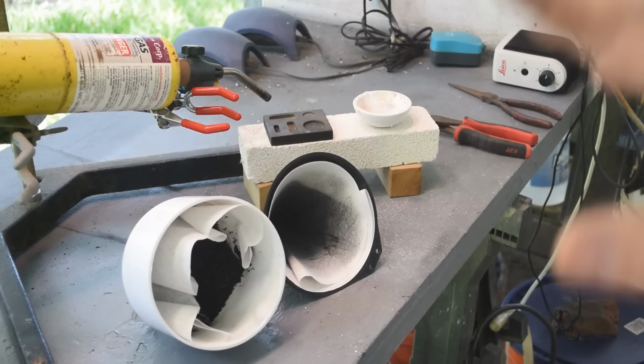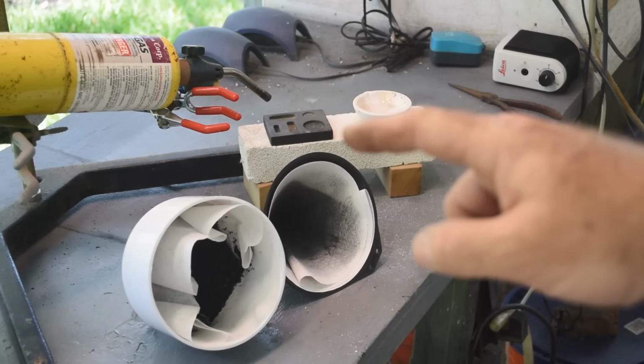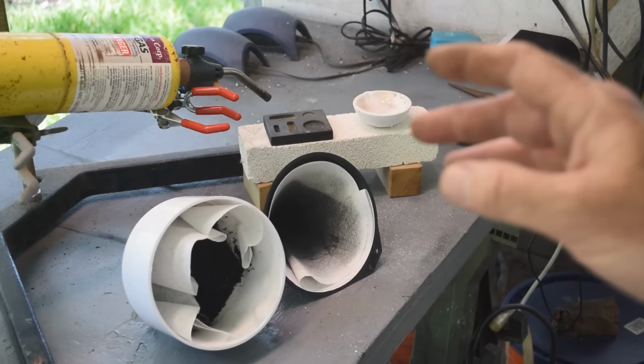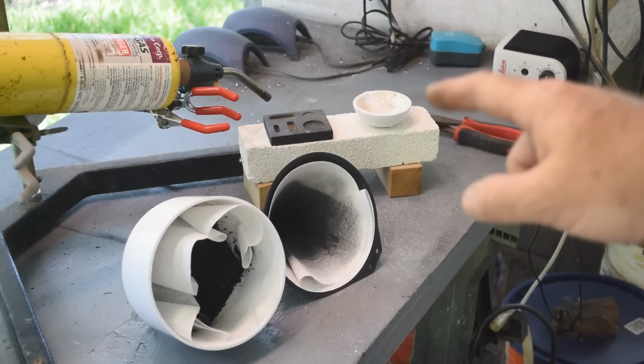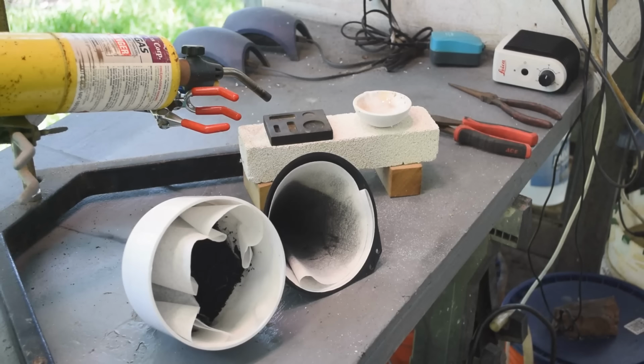Alright, so I got my melting setup out. I got my big torch. I got my small torch for preheating my mold. I might be a little over optimistic having the ingot mold out. There might just be enough for a big bead, maybe. Got a new crucible that I have just coated with borax.